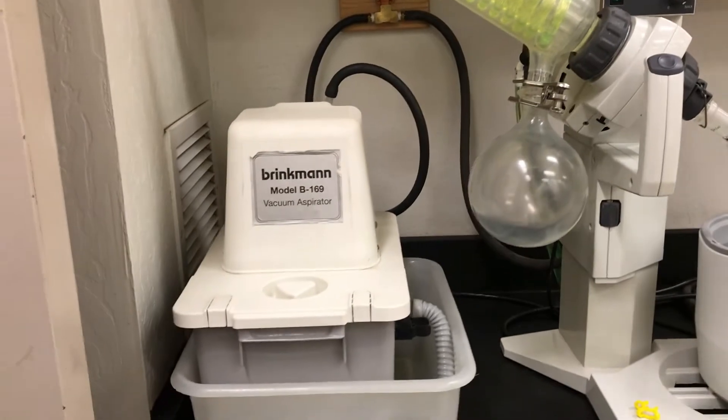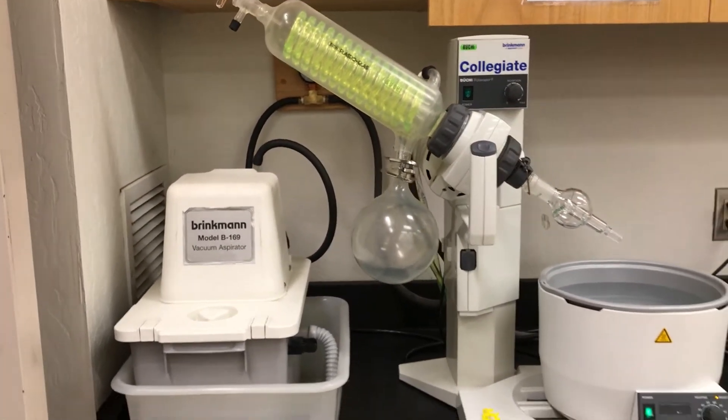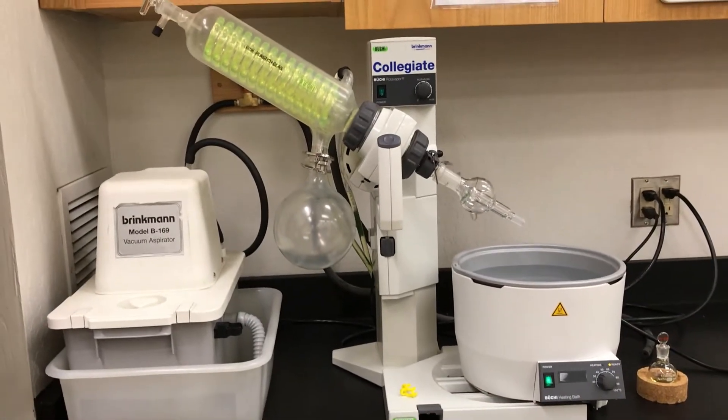And then what's important with the rotary evaporator is that you have the whole system under a vacuum. So here's our vacuum aspirator which will reduce the pressure inside the instrument.